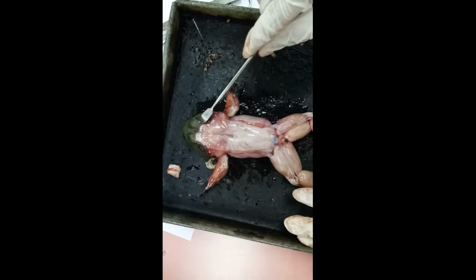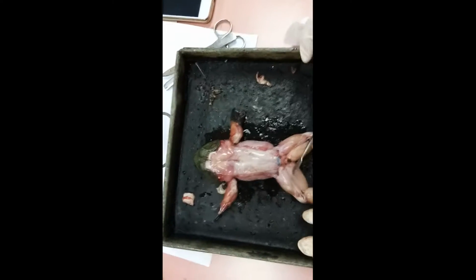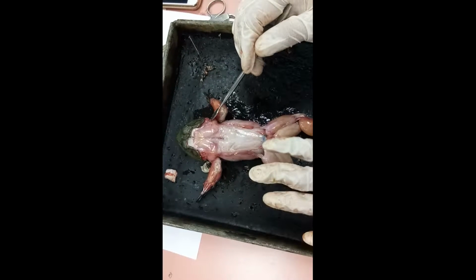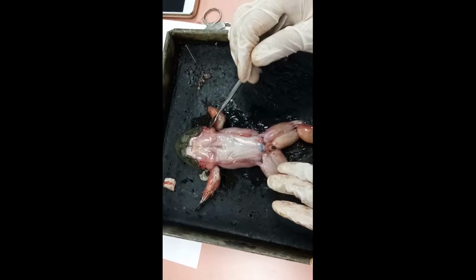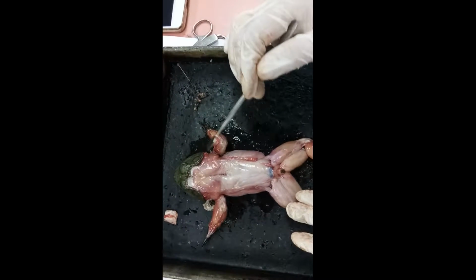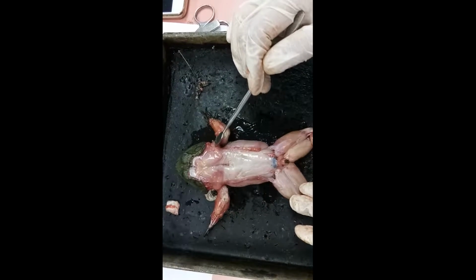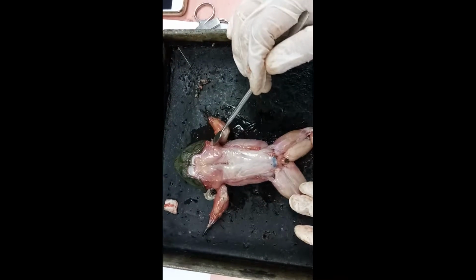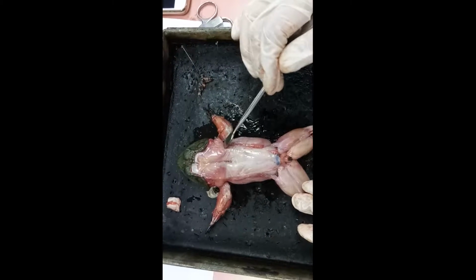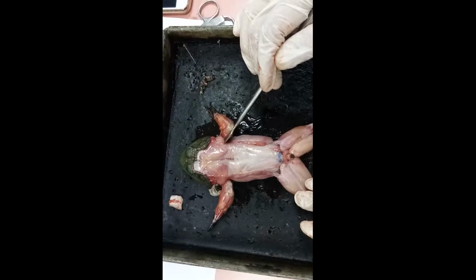In this view, we can see the depressor mandibulae and the temporalis. Among the muscles on the dorsal surface, we have the dorsalis scapulae. This muscle is behind the tympanic ring and the depressor mandibulae. And below the dorsalis scapulae is the latissimus dorsi, a wide muscle just posterior to the dorsalis scapulae.